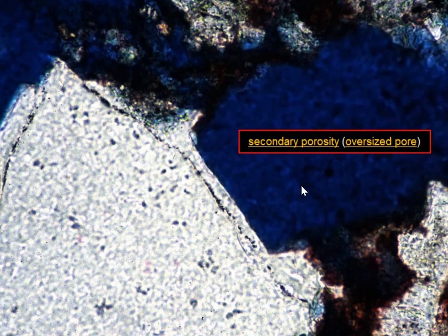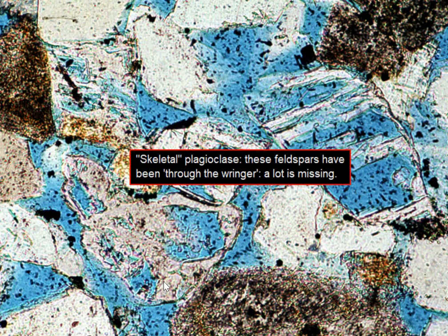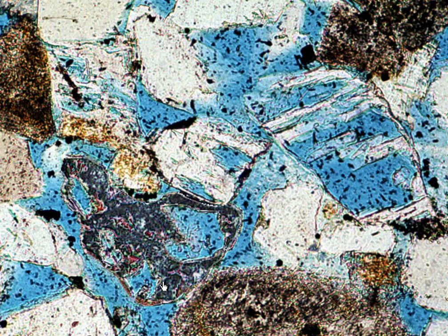Here's that straight edge they're talking about, and what is this? It's a really large secondary pore that at one point was an entire grain, maybe a feldspar grain, based on how sharp the boundary is. There it is. It's a skeletal grain. There's hardly anything left.